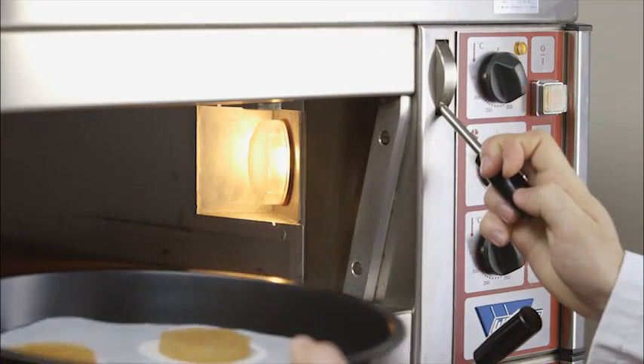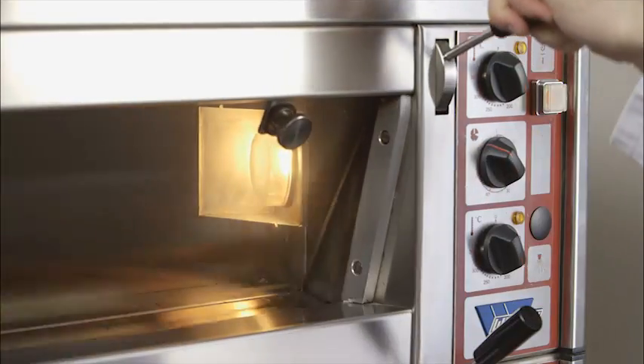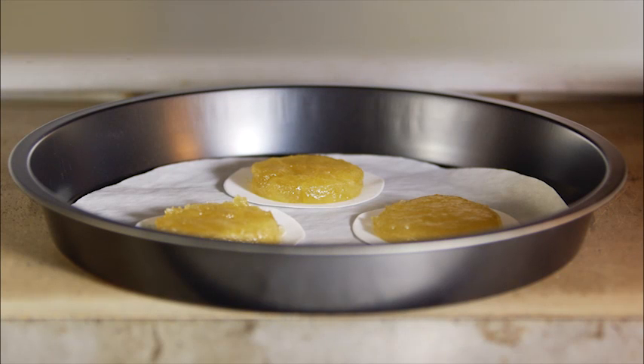This is now put into the preheated oven. Even during the baking process, we can observe the first indications regarding the baking stability of the preparation.